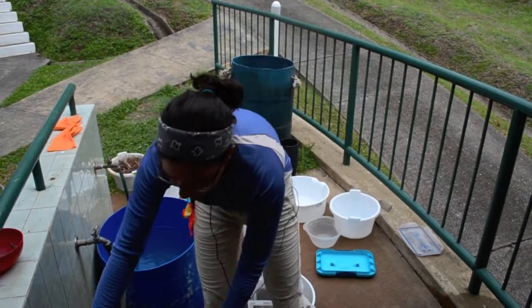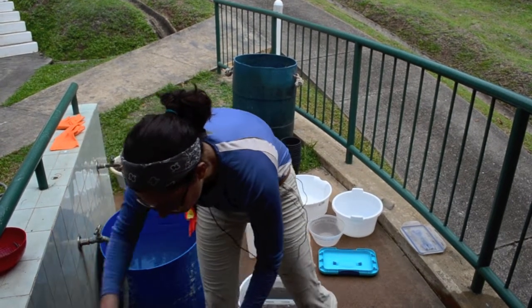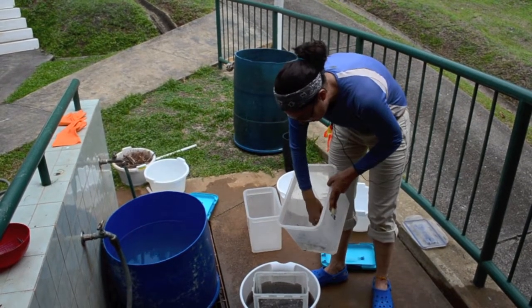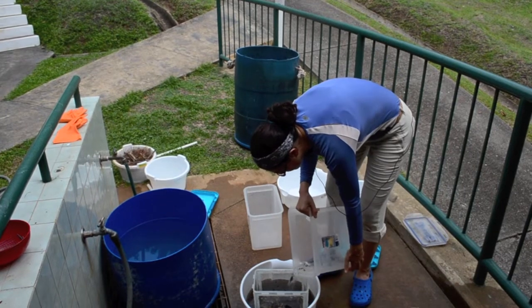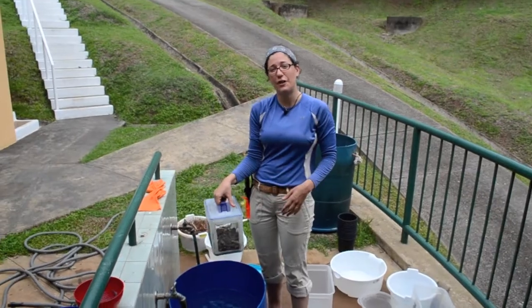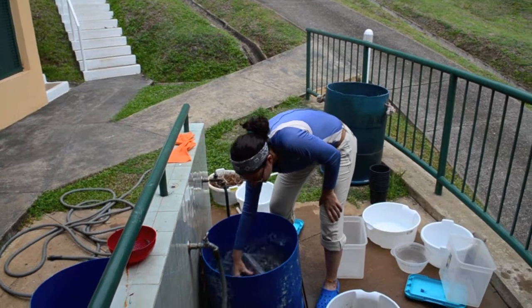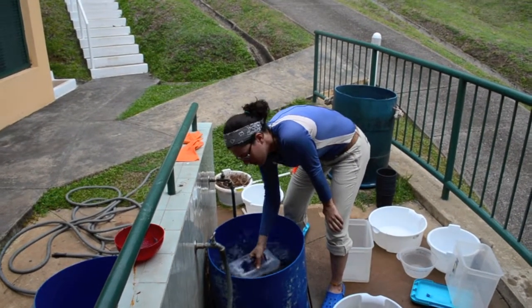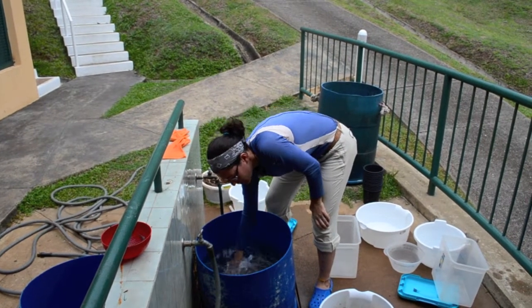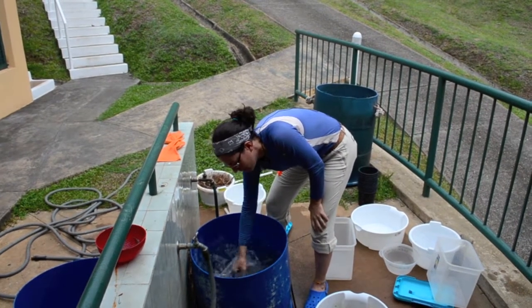And so the objective of washing it is two things. We're trying to remove the soil that's mixed in with the sample and then also separate into two size classes. So in each step, we're trying to leave behind the soil. So I put it in this big bucket of water and agitate it for a minute. So I'm going to shake it all different ways. And the idea is that there's a lot of leaf litter in here, sort of in a big ball. And I want to make sure that all the pieces that are small enough to get out of these holes in the side here have the opportunity to get out. That's why I'm shaking the sample around.